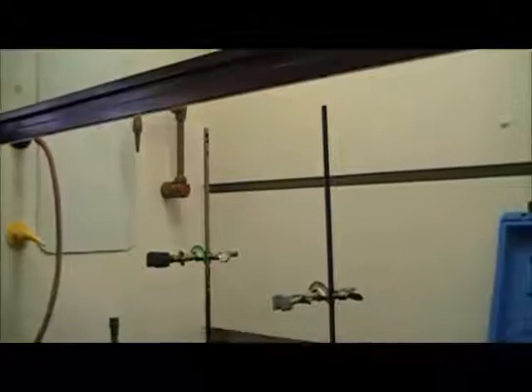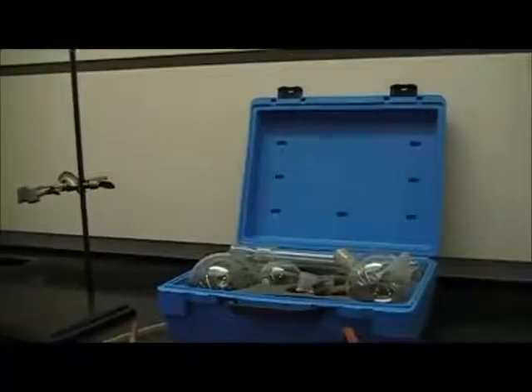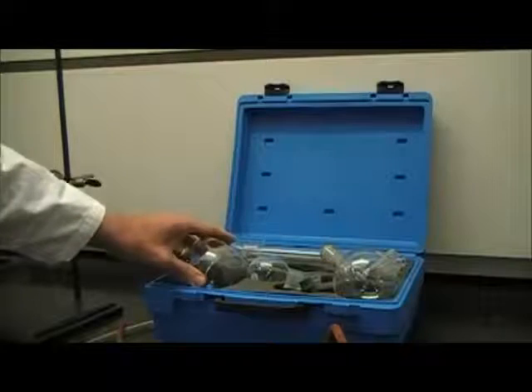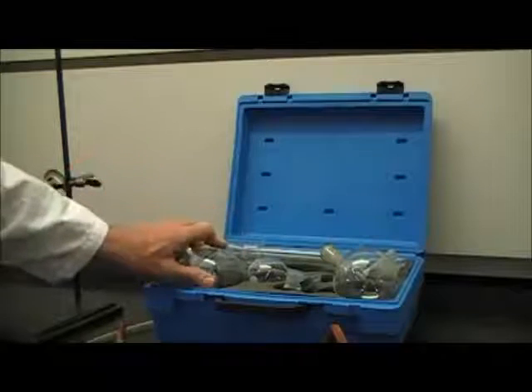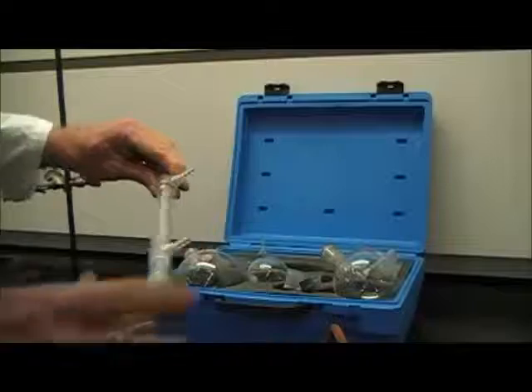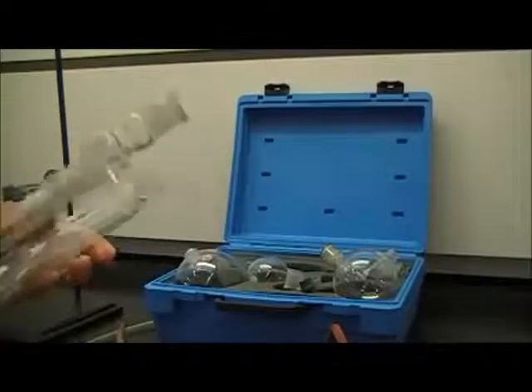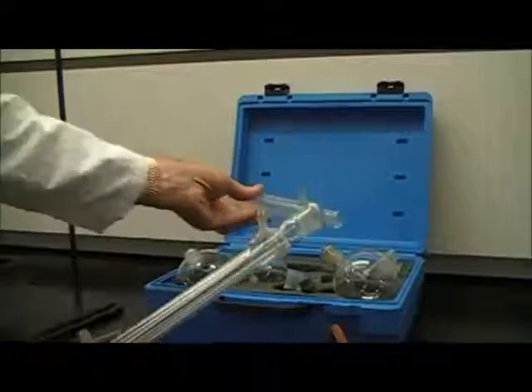In this video, I will show you how to set up and use a distillation apparatus. Over here, we have a distillation kit, and it contains several important pieces, different sizes of round-bottom glass. It has both a condenser and a column. They look pretty much the same, and I'll explain the difference between them as we go along.